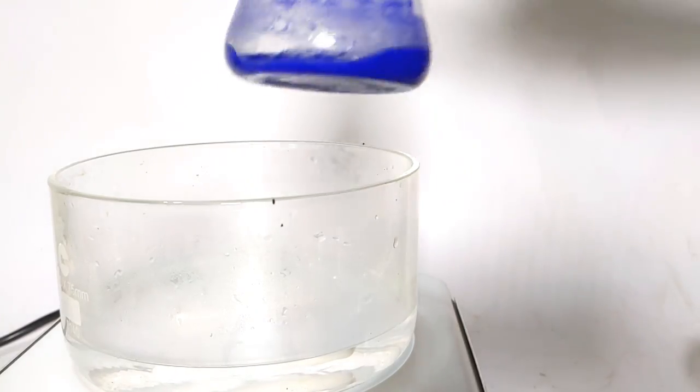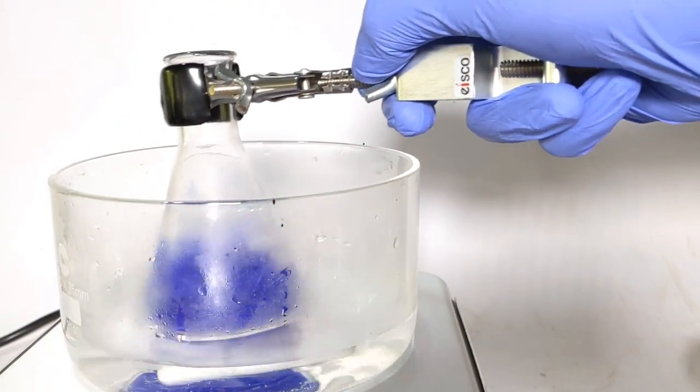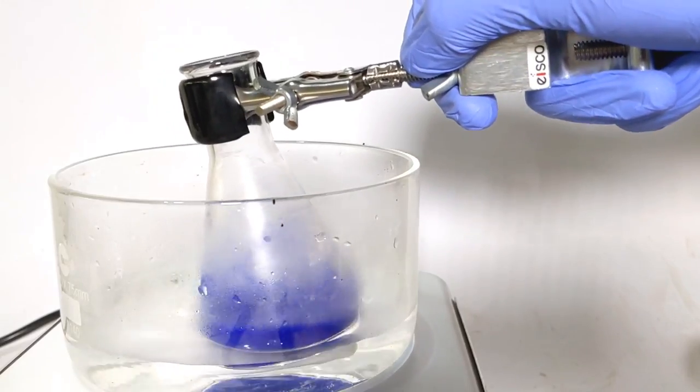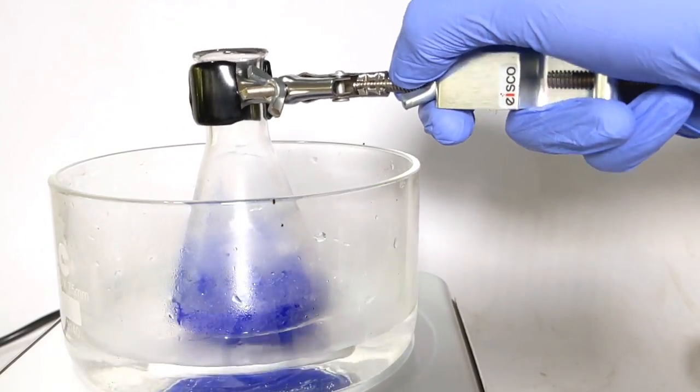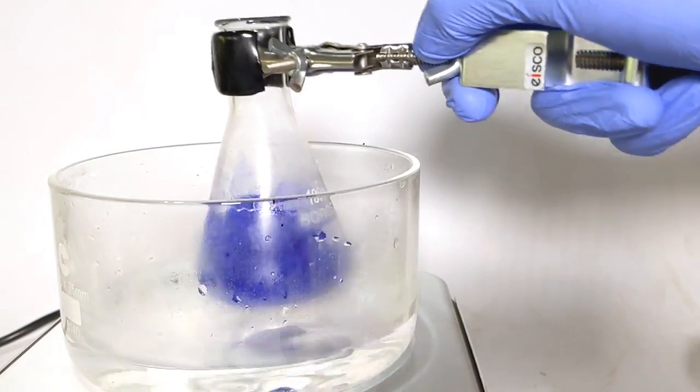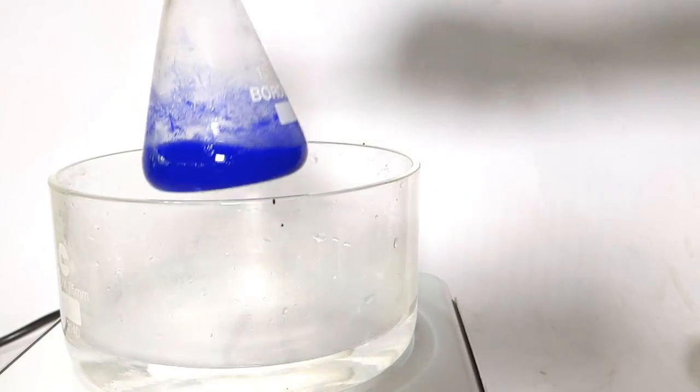As per the literature, I kept the conical flask containing the suspension of the complex in a water bath and carefully warmed the solution. Care should be taken not to boil the solution. Gentle warming would itself release lot of ammonia fumes.